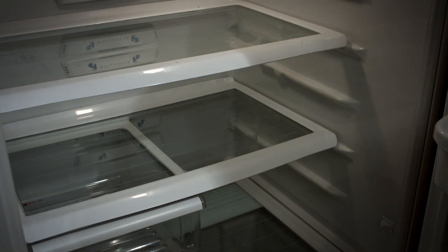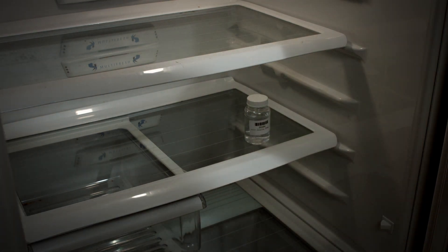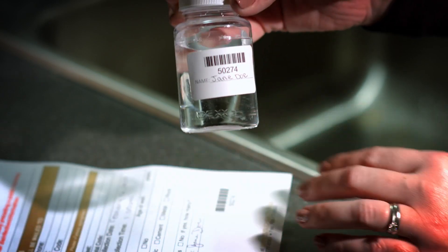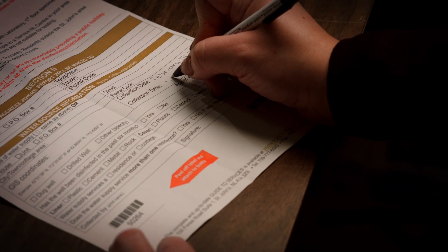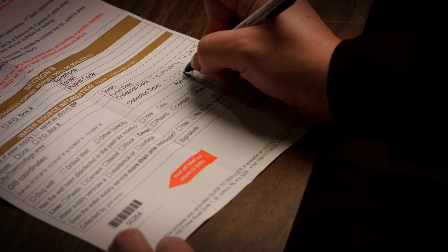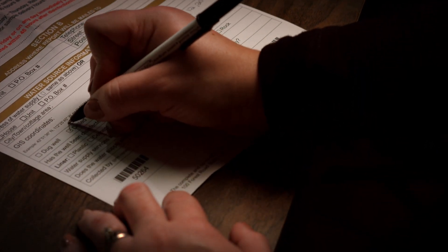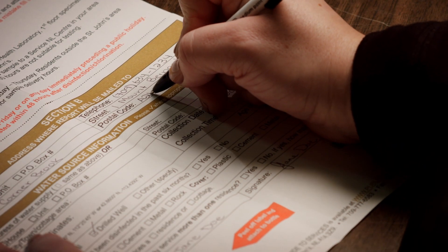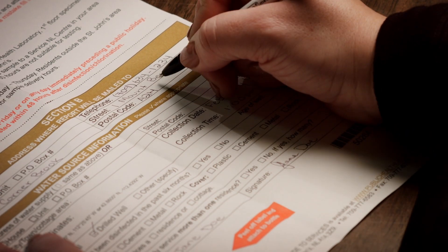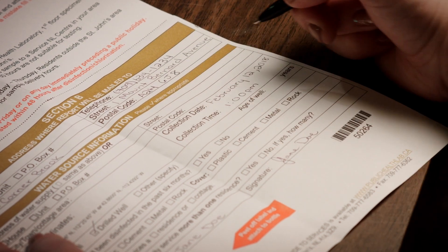Keep the water sample refrigerated until delivery, but ensure that it doesn't freeze. Complete the label on the sample bottle and complete the requisition form enclosed with the sample bottle. Make sure that the collection date, collection time, water source, and contact information are completed, as these are all required fields. Samples will be rejected for analysis if this information is not provided.